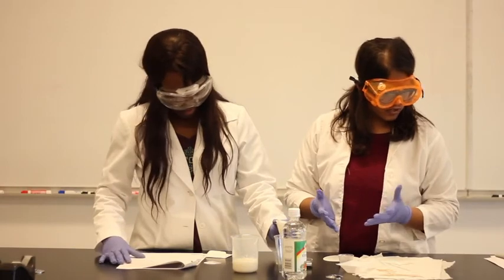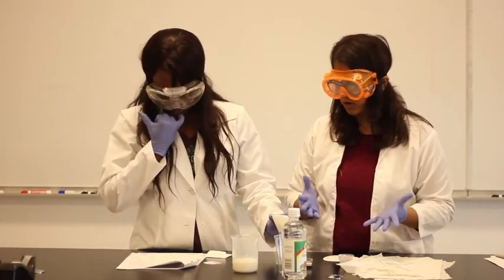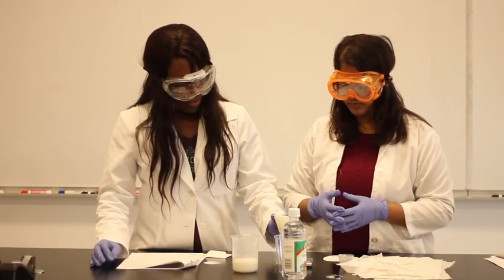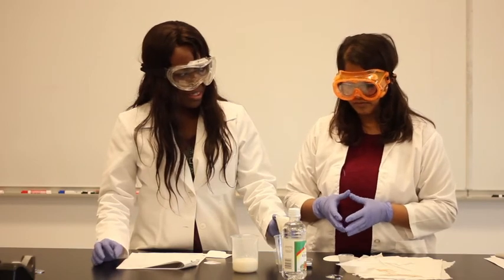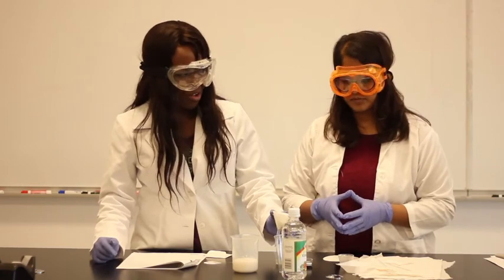Now you can use other samples like non-fat milk, skim milk, or any other milk to see the percentage of casein. If you want to make this very interesting, you can look at milkshakes and such that supposedly have very high protein and test to see if the percentage you get matches what's on the label. Then you can call the company.